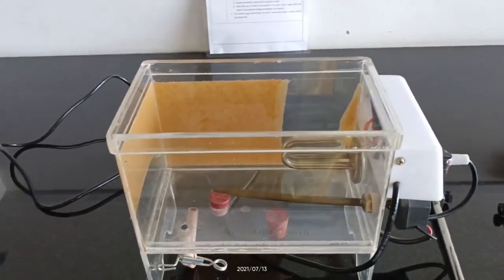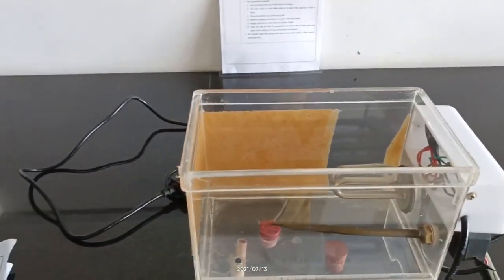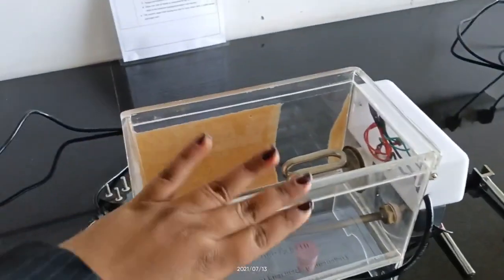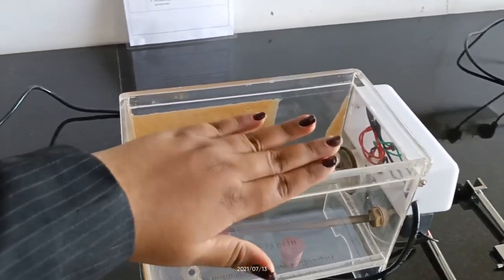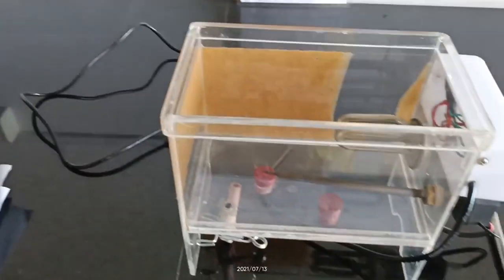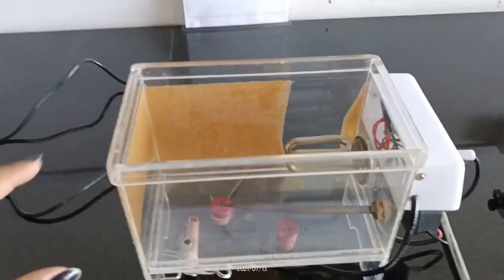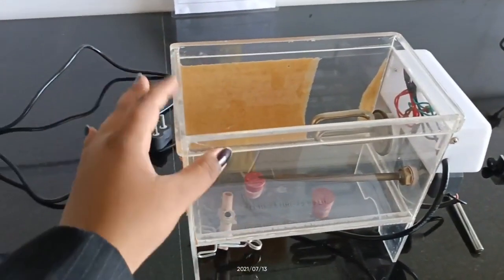Let's see the parts of the student organ bath one by one, and what is the specific use of each part. The first part is the outer jacket. It is made up mostly from glass, or steel, or PVC — polyvinyl chloride.